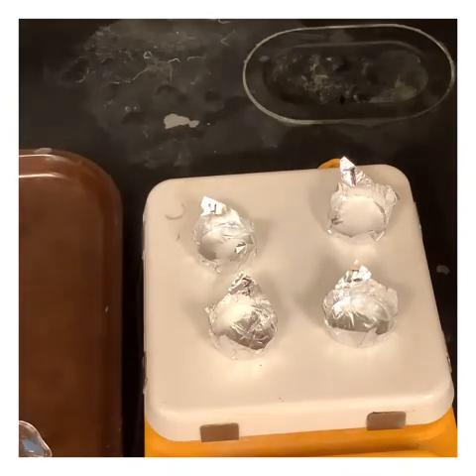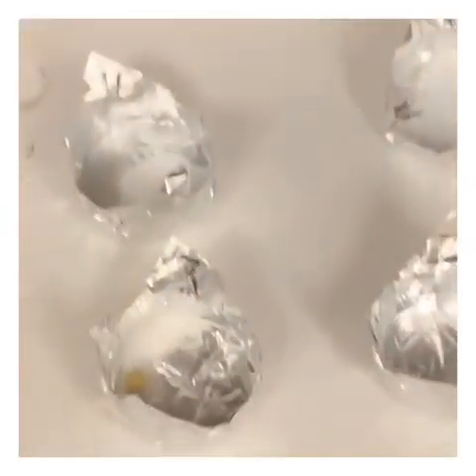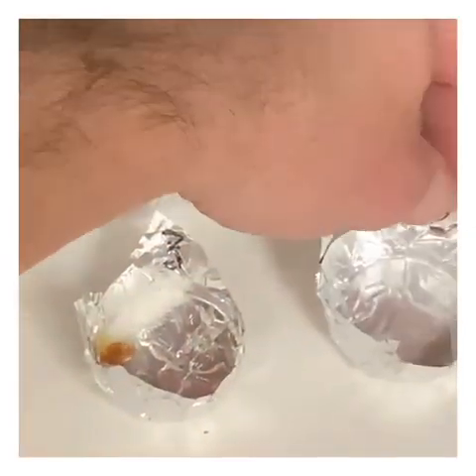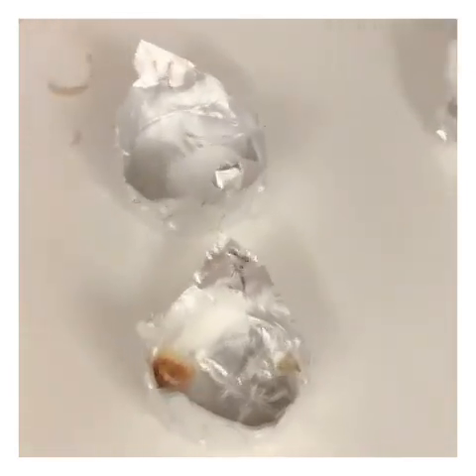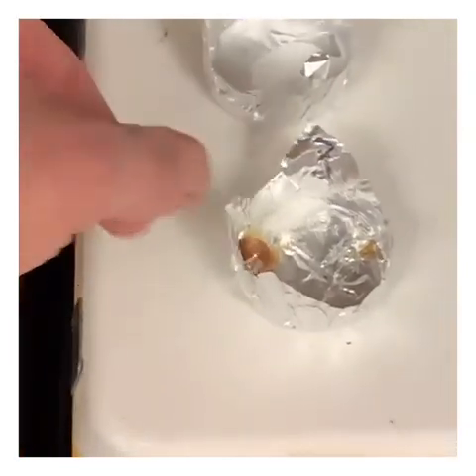And if we look real close, you'll notice that this guy went into solution very quickly. This one's liquid. So we're going to go ahead and pull this off. We can see that that's a liquid. We can also see that this one has melted as well and is bubbling quite nicely. So we're going to go ahead and pull that one off.